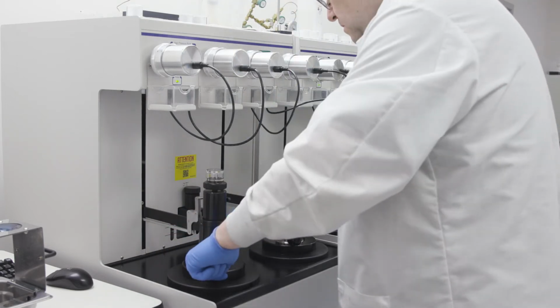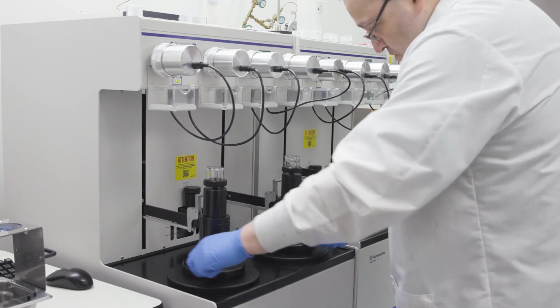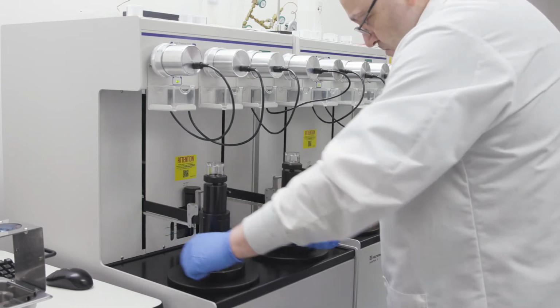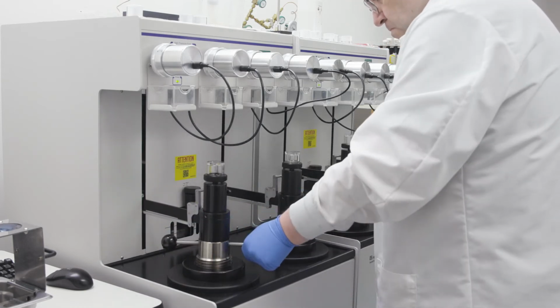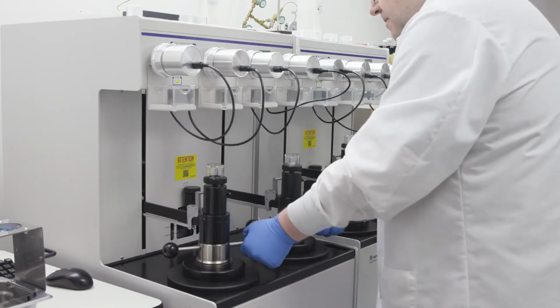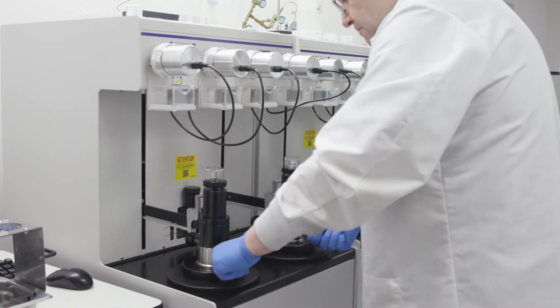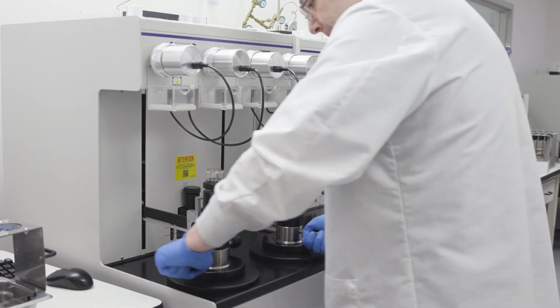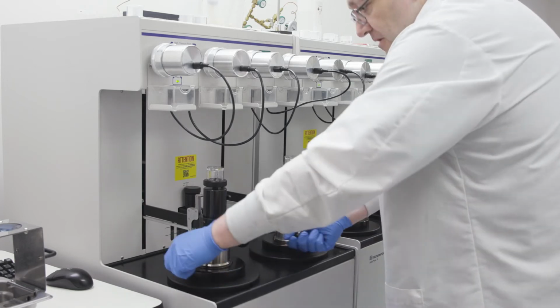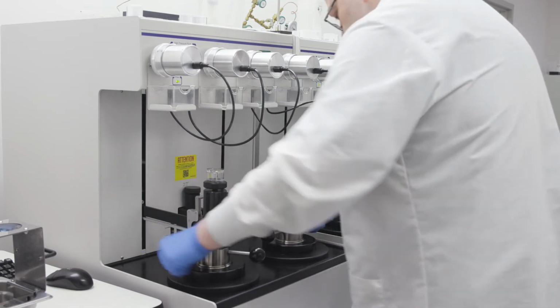To pull that fluid into the right chamber and to help expel air from both chambers, Chris loosens the chambers, then retightens them. Notice that quite a bit of air is coming up into the right vent valve reservoir. After another cycle of loosening and tightening, more high-pressure fluid is needed to fill the right chamber. Chris will repeat loosening and tightening the chambers until very little additional air comes from those chambers.